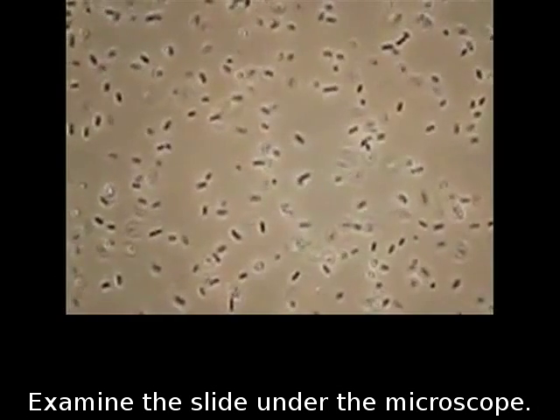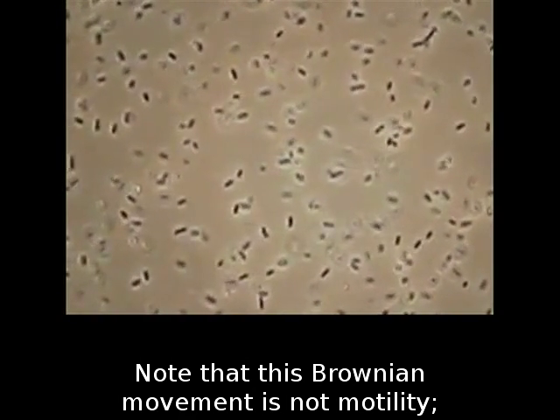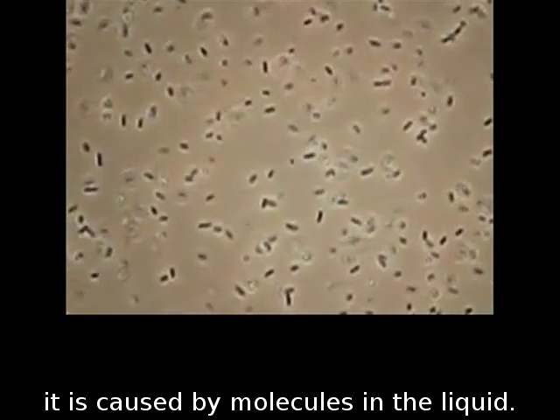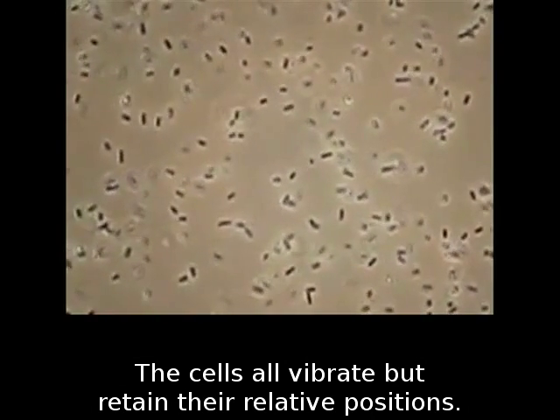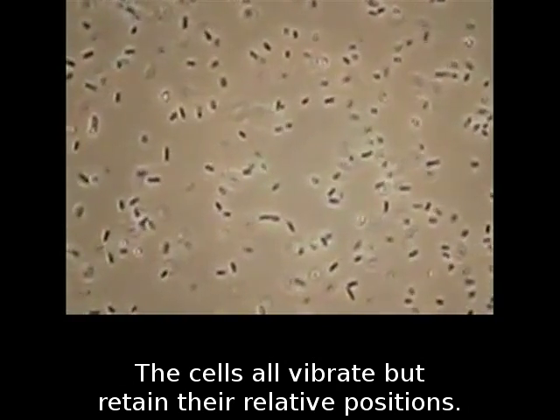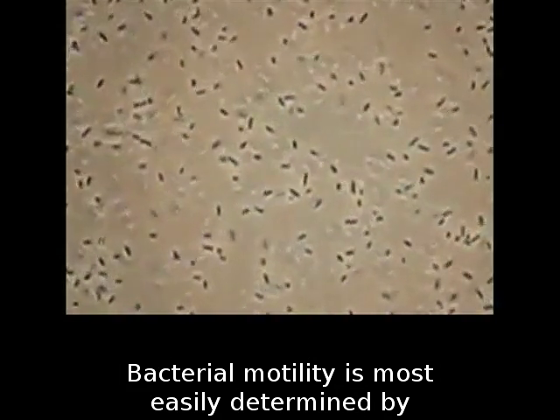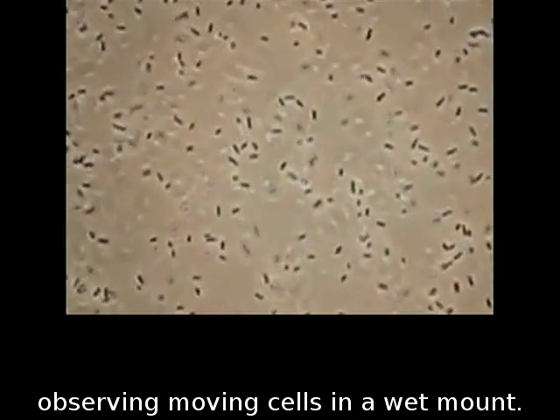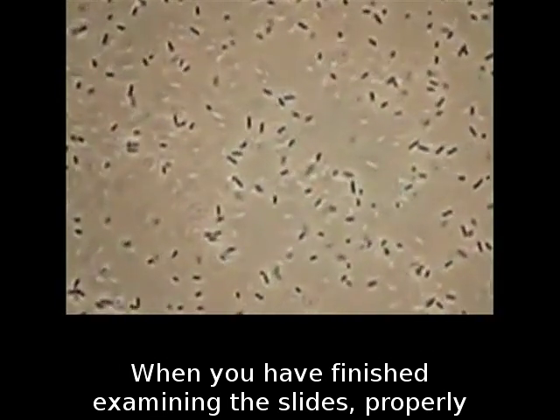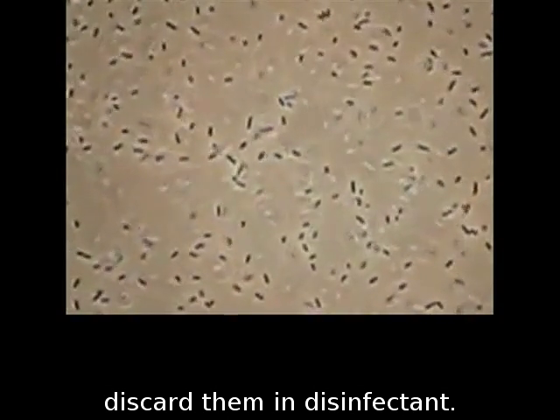Examine the slide under the microscope. Note that Brownian movement is not motility — it is caused by molecules in the liquid. The cells all vibrate but retain their relative positions. Bacterial motility is most easily determined by observing moving cells in a wet mount. When you have finished examining the slides, properly discard them in disinfectant.